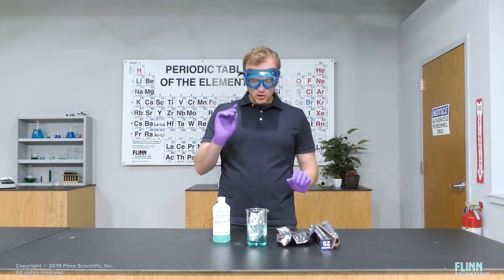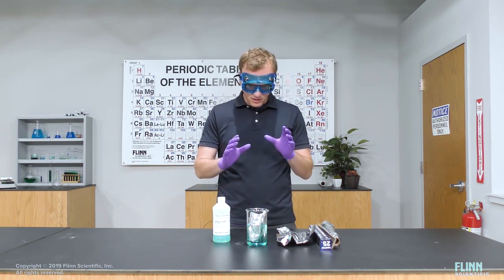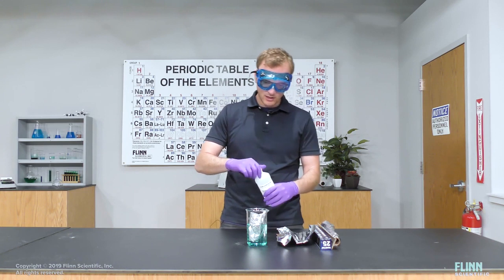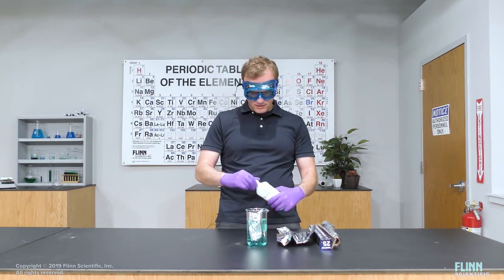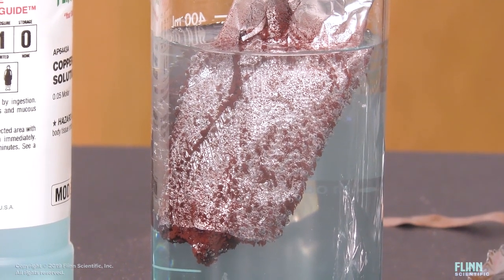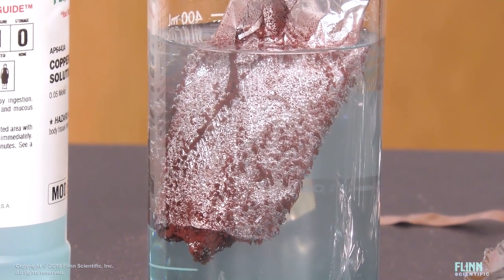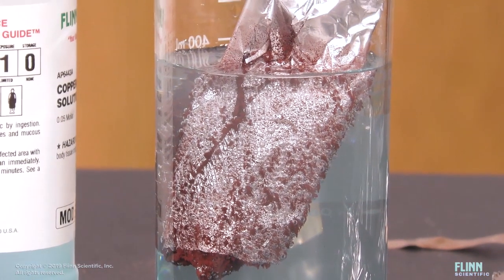So what you're looking for are signs of a reaction. In this case, if you observe the aluminum over time, what you'll notice is the aluminum reacts with the copper chloride. And I'm going to add a little bit more here to see if we can see evidence of this happening on a faster time scale. Now at this point, this has been sitting here for a couple minutes, and you can see towards the bottom of the beaker, you see evidence of a chemical reaction. You see some reddish solid. And if you look at the edges of the foil, you can see it start to peel away. So when we put aluminum foil in copper chloride solution, we see a reaction happen.